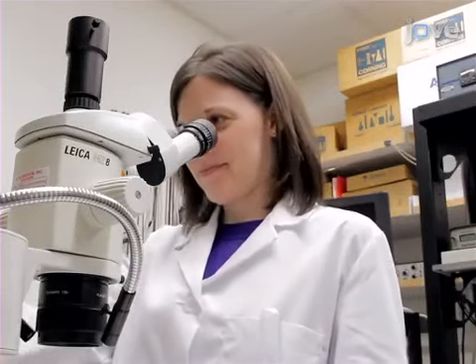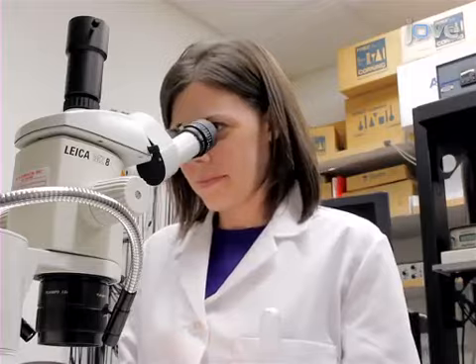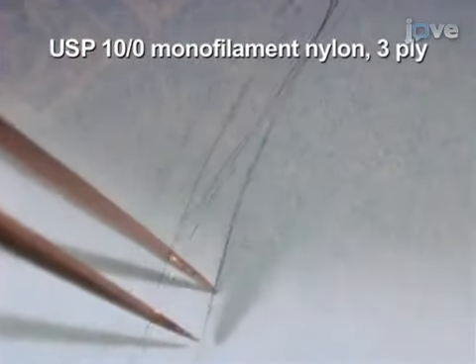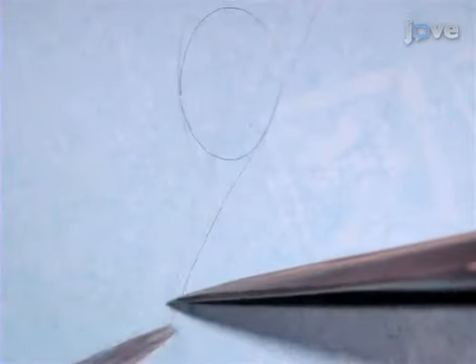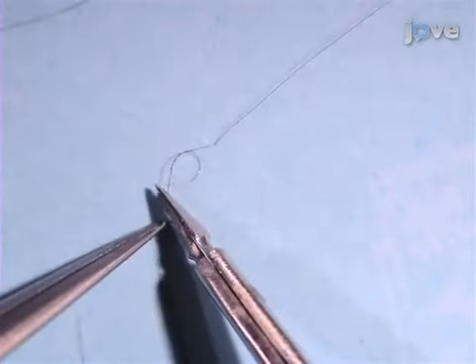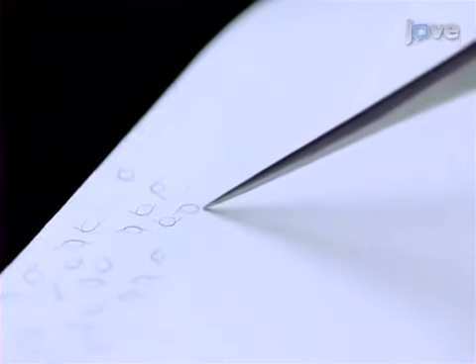The first step is to prepare the suture loops that will be used to hold the larvae in place during force testing. Use forceps to separate non-sterile suture into three strands. Once separated, begin to tie a double overhand knot in one of the strands but stop before tightening the knot completely to make a small loop instead. To finish the loop, use scissors to cut excess suture from the tails. Place the loop on the sticky side of a sticky note for later use. Make two suture loops for each larvae that will be tested.